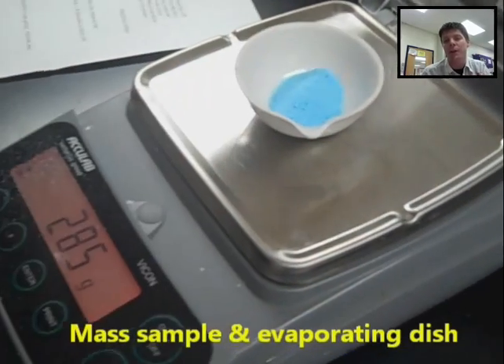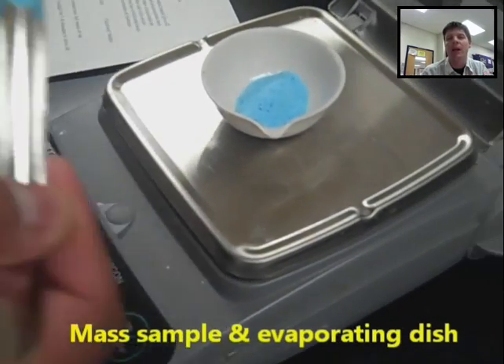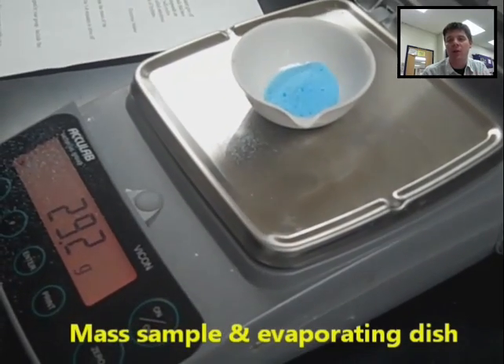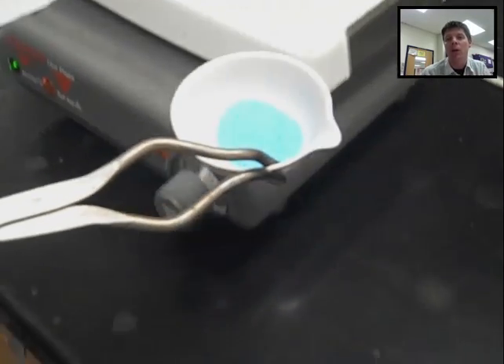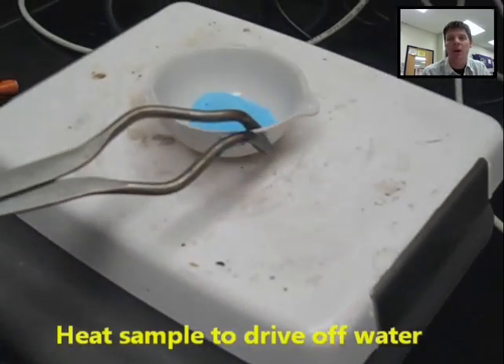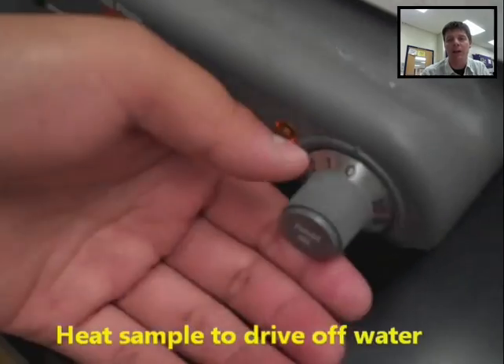Then the students are going to add the sample of copper sulfate and they'll measure the mass again after adding the sample in order to determine the mass of copper sulfate present in the evaporating dish.